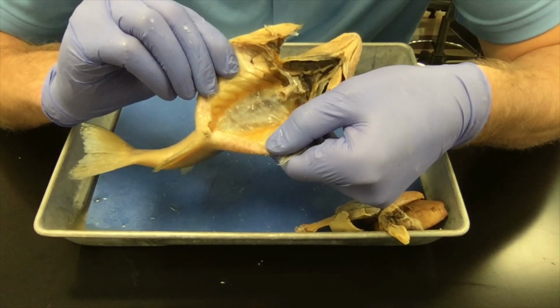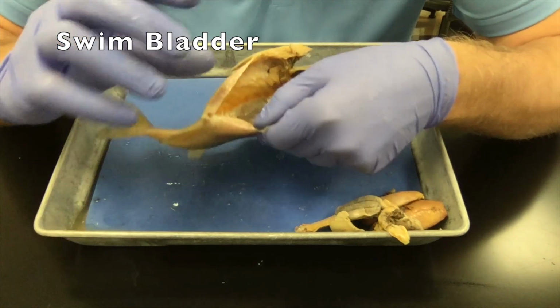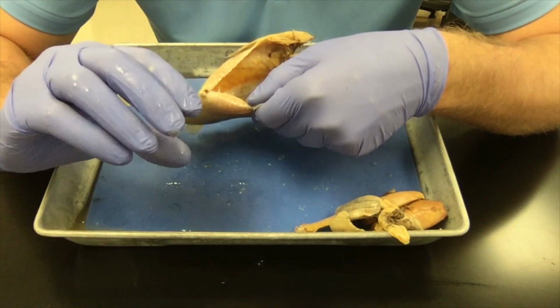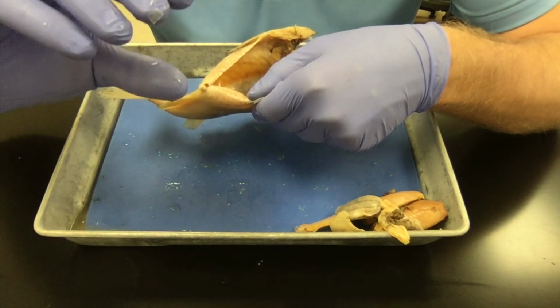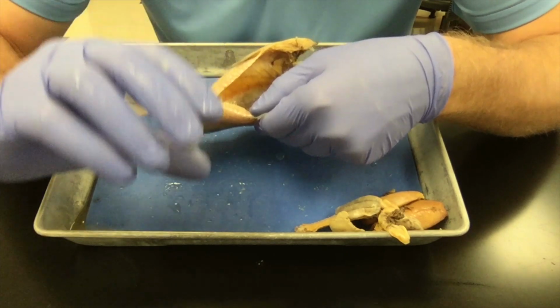The last structure I want to show you on our fish is the fish's swim bladder. The swim bladder is a unique organ. It's sort of like a balloon inside the fish. When the fish wants to go up in the water, it fills its swim bladder up with gas and it moves up. When it wants to move down, it squeezes gas out of its swim bladder and it moves down.